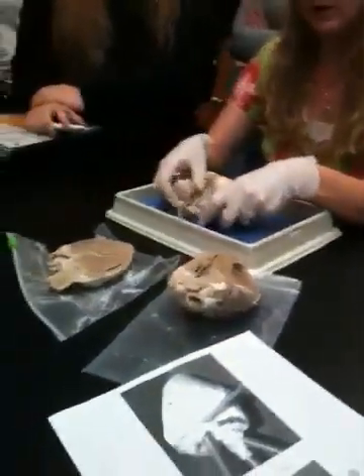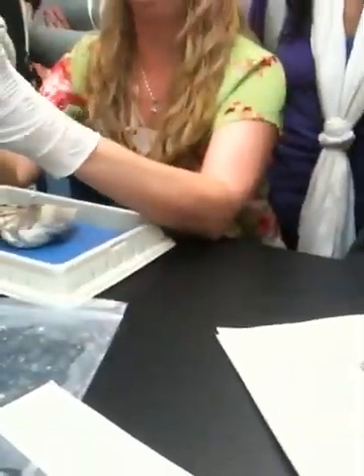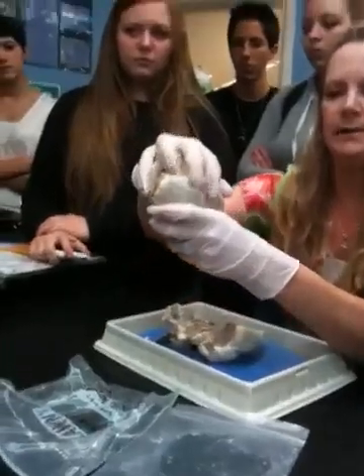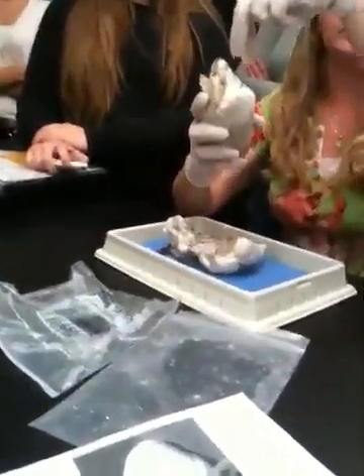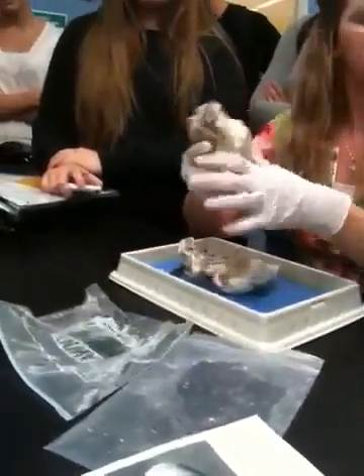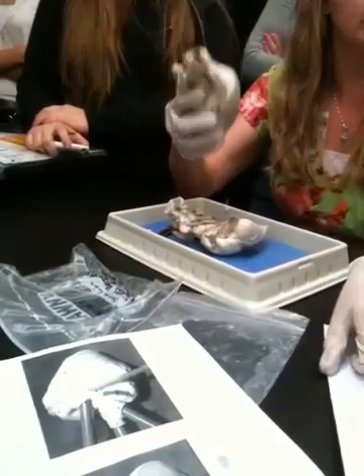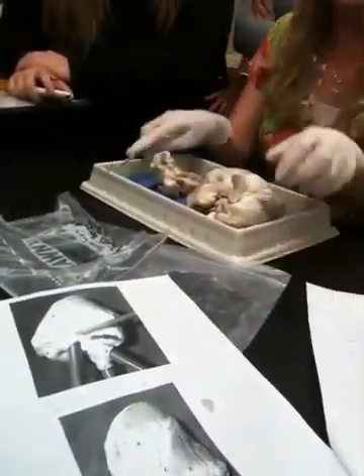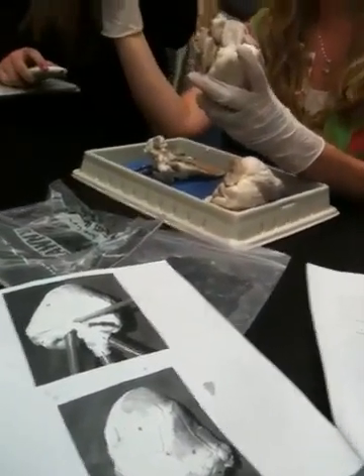No, now what's going on is it was as if you took the heart like this and you cut it across this way, and then took the top off. So now you'd be looking downwards into it. This right here is the right ventricle, and this is the left ventricle. Oh, so the atriums don't show. Here the atria are cut off. You cut this whole top part off.